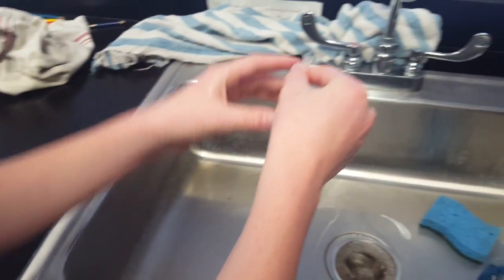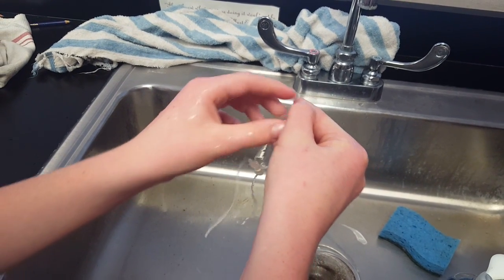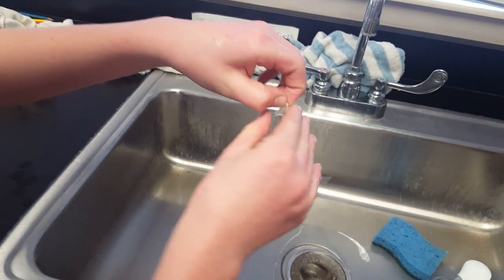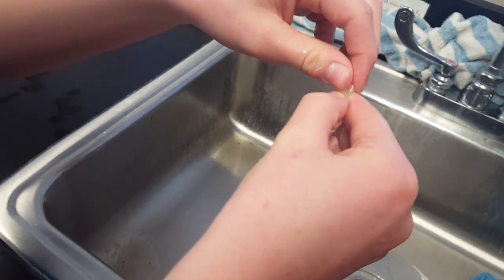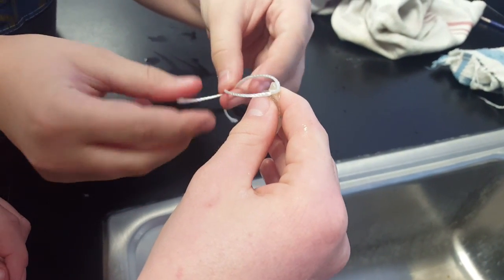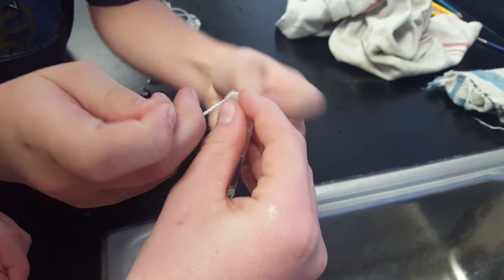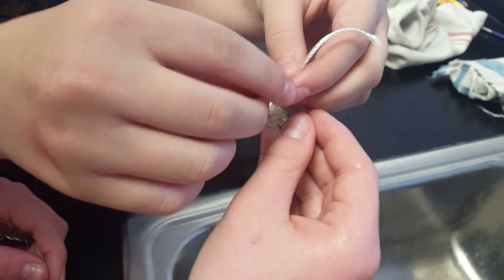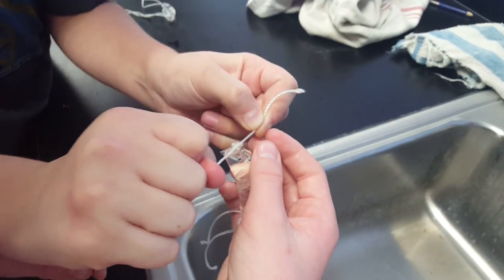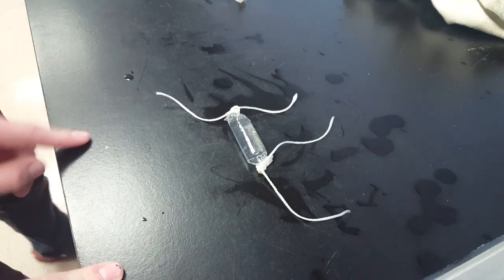It'll probably squirt out a little bit when you're twisting it up, but that's okay. Next, he's going to twist off the other end just like he did the first time, and again remember to fold the tube in half. Then student assistant number two is going to add that second piece of string to the end and cinch it off nicely with a few knots, just to make sure it doesn't leak at all. Now there are no openings into this dialysis tubing except for the tiny little pores that are actually in the membrane of the tube itself, just like one of your cells.